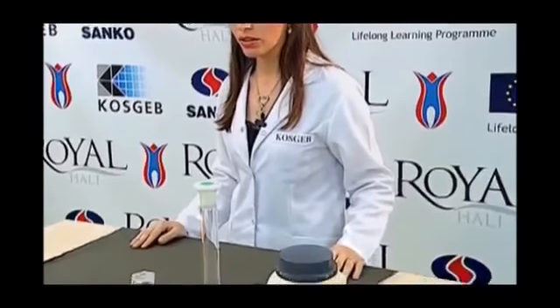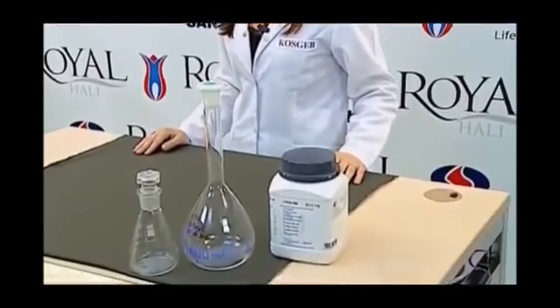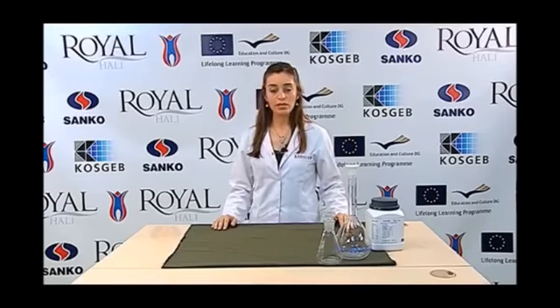The purpose of the determination of the pH testing is to calculate the change in the pH values due to the natural structures of the textile products and the chemical processes applied to them during the production processes. Because of this feature, we will be informed about the chemical processes which are applied to the fabric in a pH test. This test is applicable to all kinds of textile products.